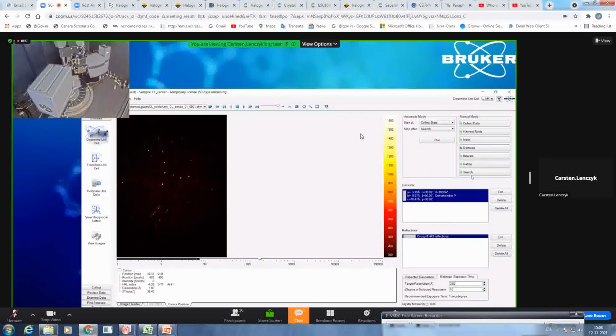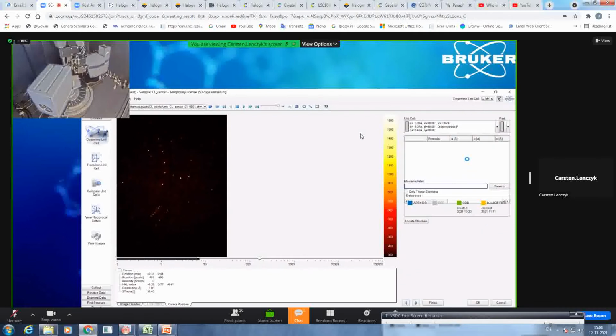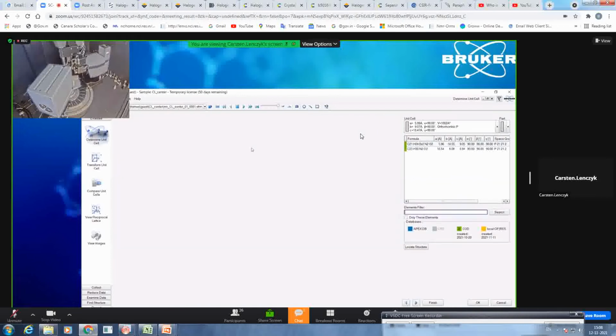Before you start a measurement, I would always recommend making a cell check and checking whether the substrate you are about to measure has not been published so far. We have different databases here. The CSD is not installed because we currently have a test PC attached to the instrument. But if you download CellCheck CSD from the CCDC homepage and install it, it will automatically be implemented in Apex4. So you will have access to the CSD database.